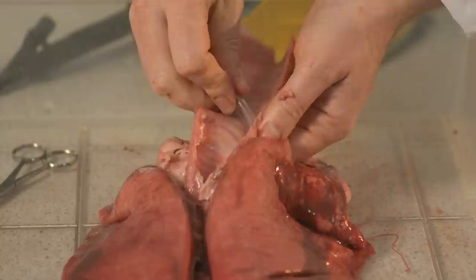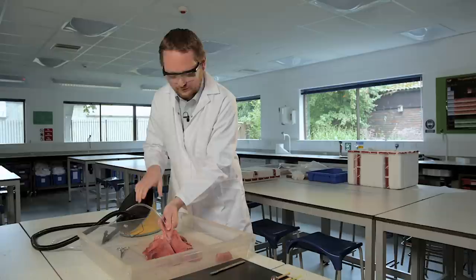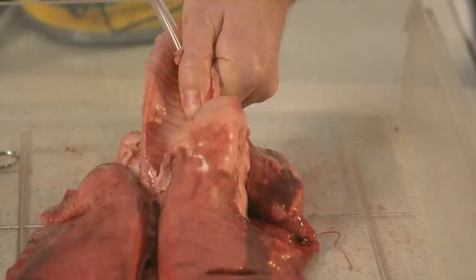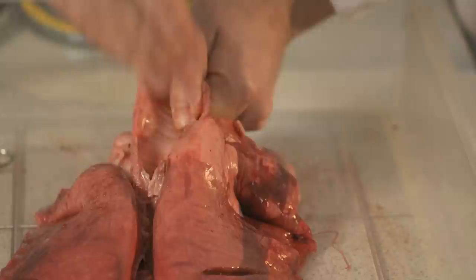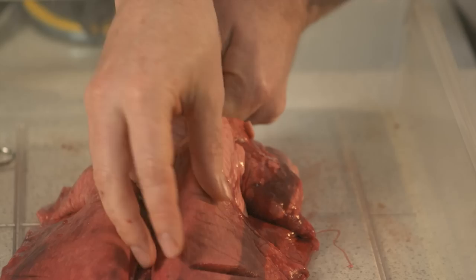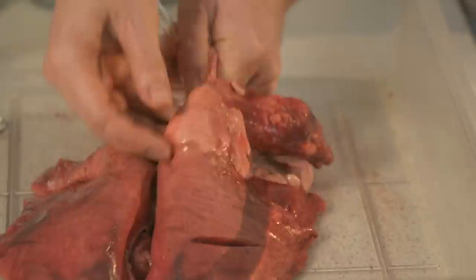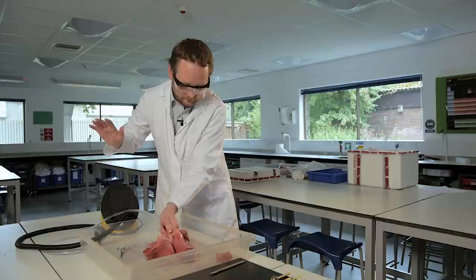So let's have a go at inflating this area. I'm going to take the tube, push it down until I get a good seal in that tube, hold that seal. And I would probably get a student to have a go at pumping this but I will push down here. And there we're getting inflation. Inflation only down to this bit. So this part of the lung is not supplied by this tube, but the upper lobe is supplied by the tube.